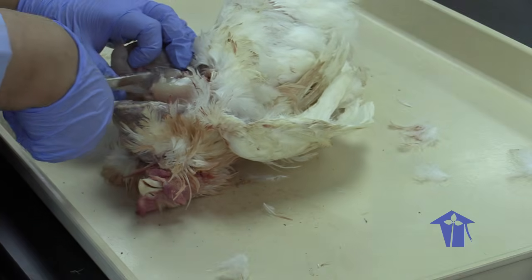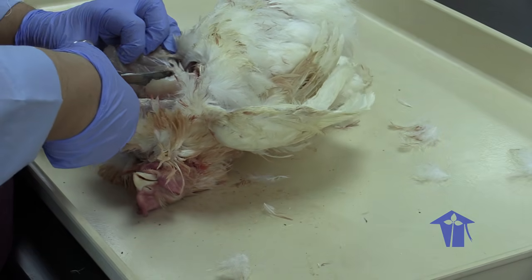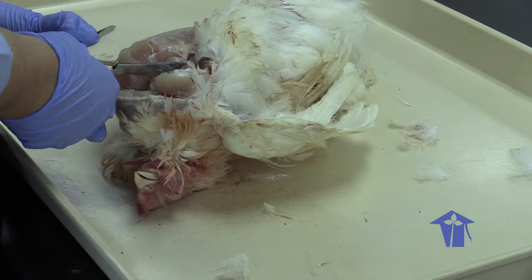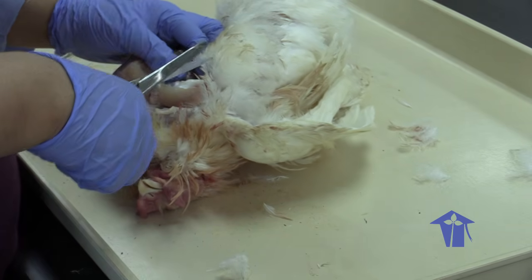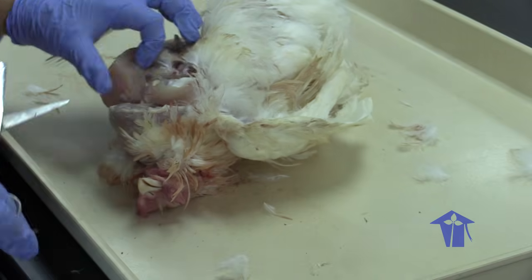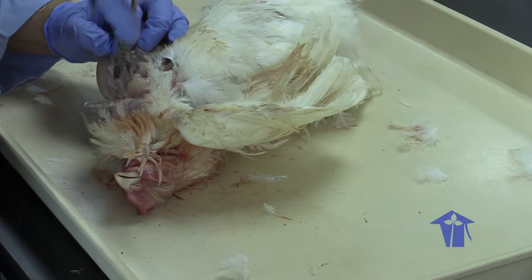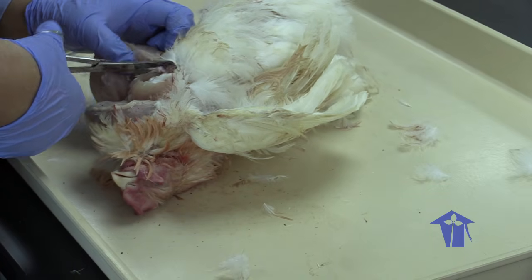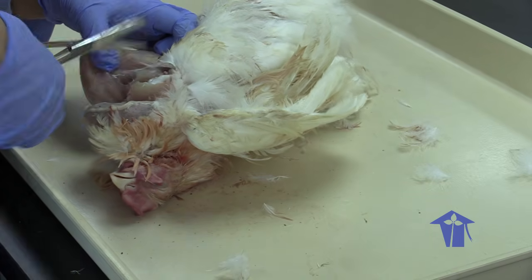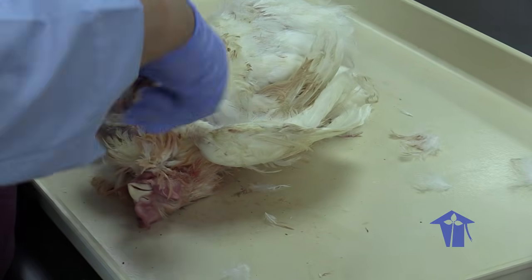So you know, like when you roast a full chicken at home, you get this wishbone. I'm trying to cut through that now. That wishbone is called the furcula, and that helps to support that massive block of flight muscle. So even though the chickens do not really fly, they still have that massive block of muscle.